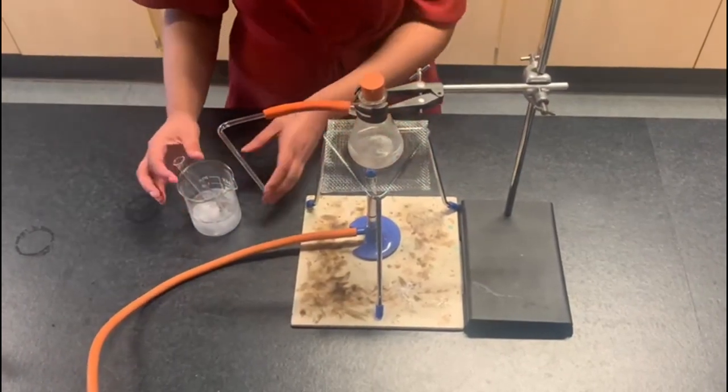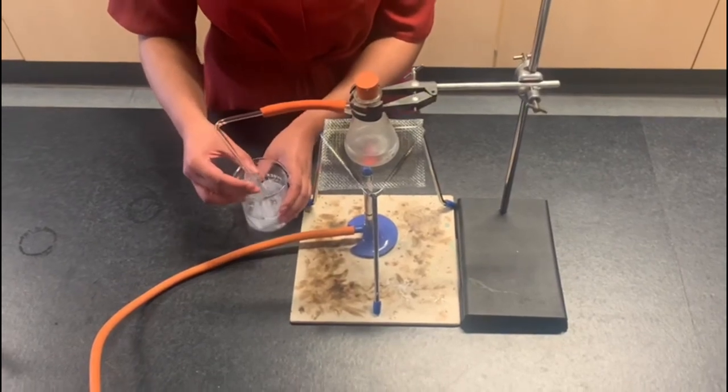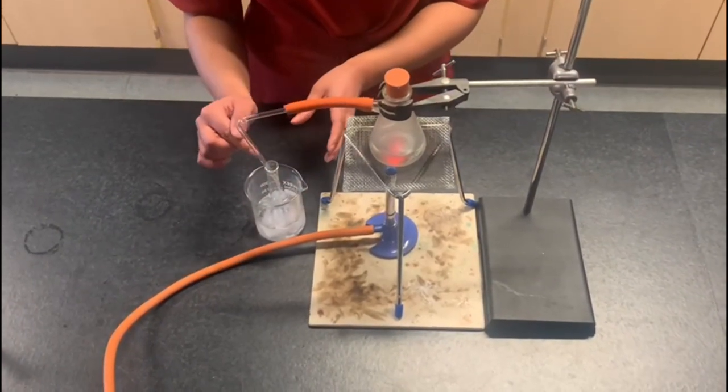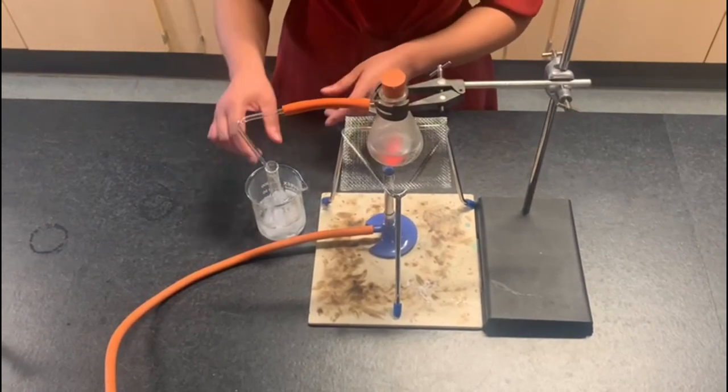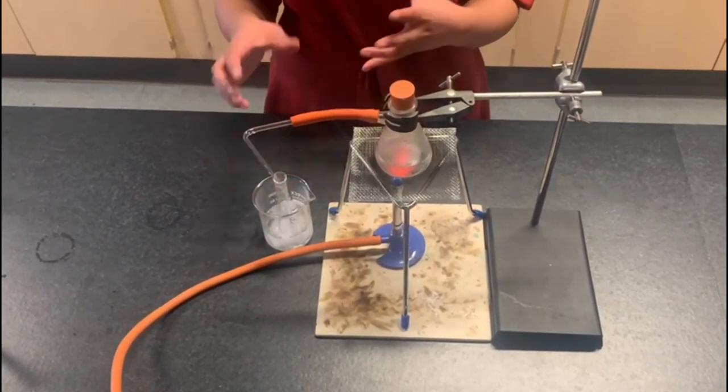As we do that I will place the test tube under here so it can collect the distilled water. The test tube is also placed in a water bath of ice cold water.